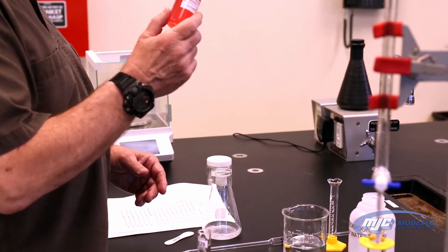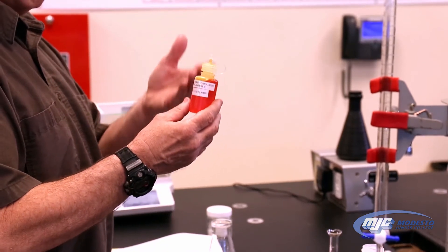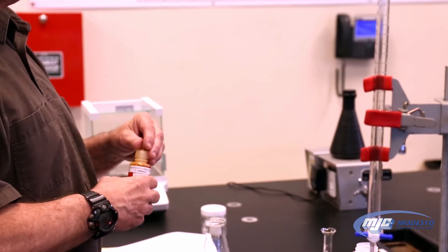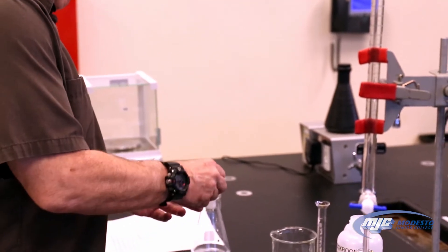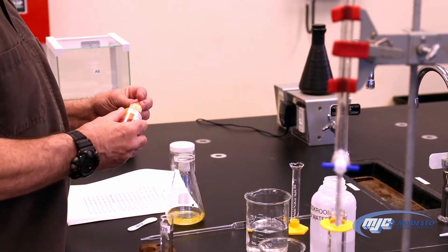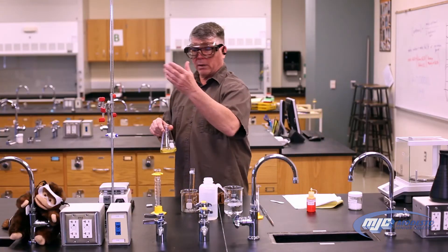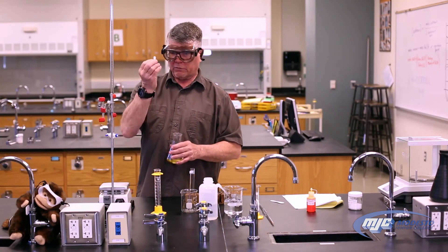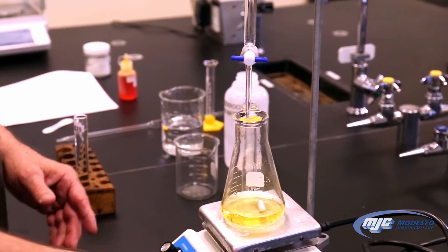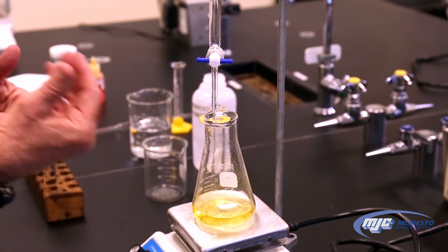We're going to add the indicator Bromothymol Blue. When we put it in, it'll look yellow and it'll turn green at the endpoint. The amount we put in doesn't affect the actual reaction, so a few drops is good. Give it a swirl. While filling up the burette, put a magnetic stir bar into the flask, put it on the magnetic stirrer, turn it on, and let the stir bar start to dissolve the KHP.